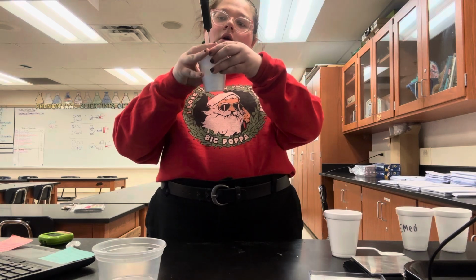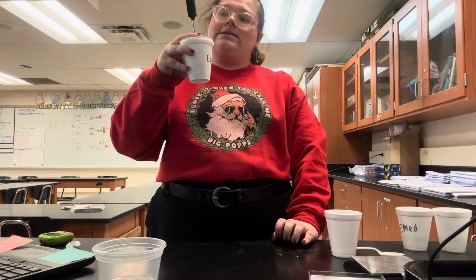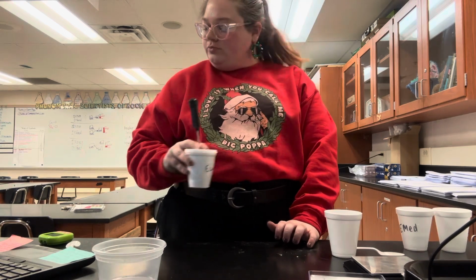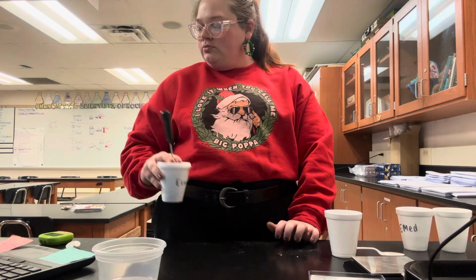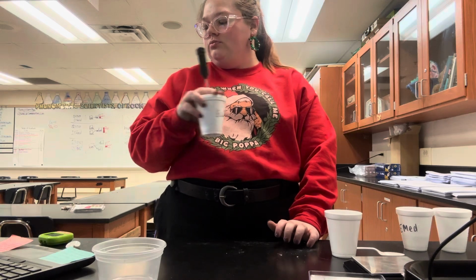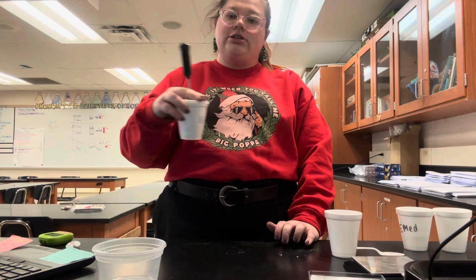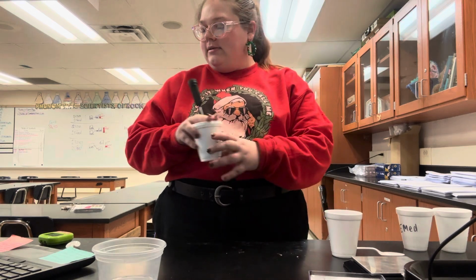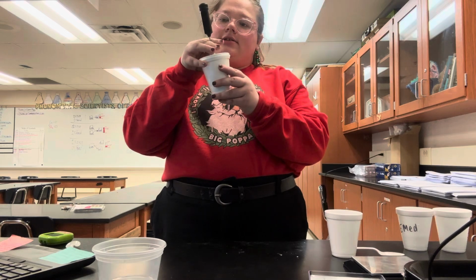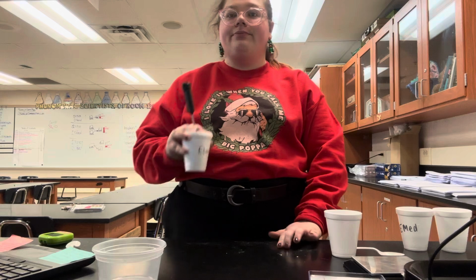Your 0.0 time measurement for degrees Celsius is 17.0. I'm stirring it around so the reaction can start taking place. 30 seconds in, our temperature is still 17.0 degrees Celsius.